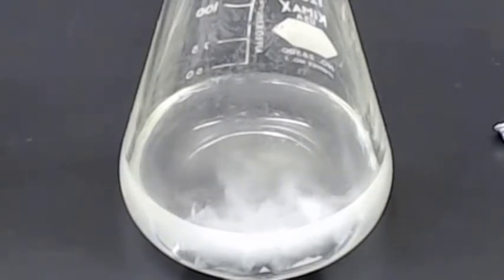Now, if we were to collect this gas and perhaps fill a balloon with this gas and light it, we would see that it would burn, much like the hydrogen balloon that we saw in a demonstration back when we were talking about thermodynamics. So in fact, we're forming hydrogen gas, and we're also forming zinc 2+ ions. Now, they're colorless, so we're not going to see them. But if we let this sit here long enough, the zinc metal would go away, and all we would have is a clear solution.